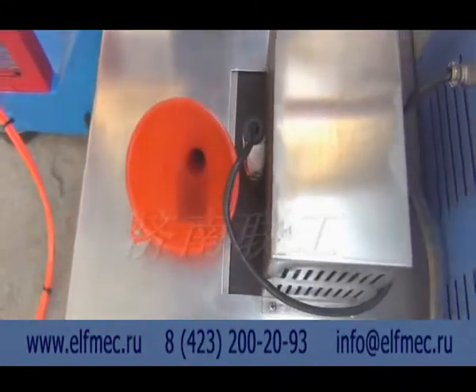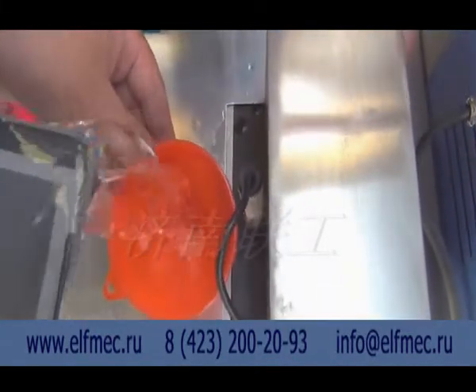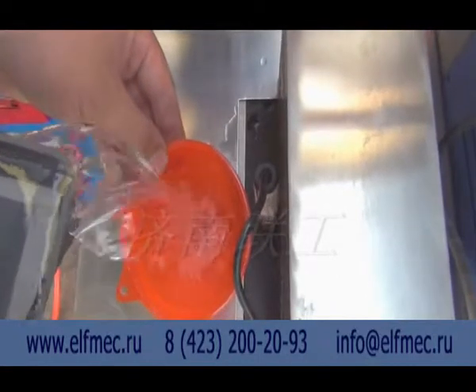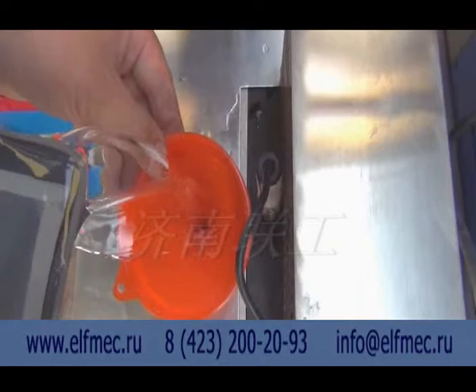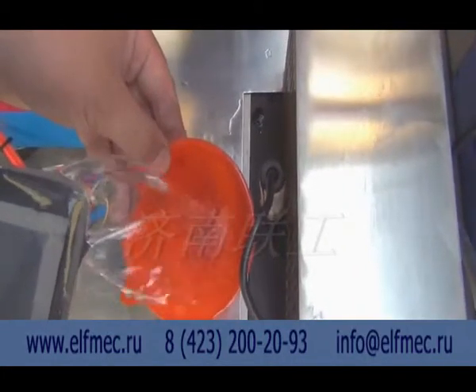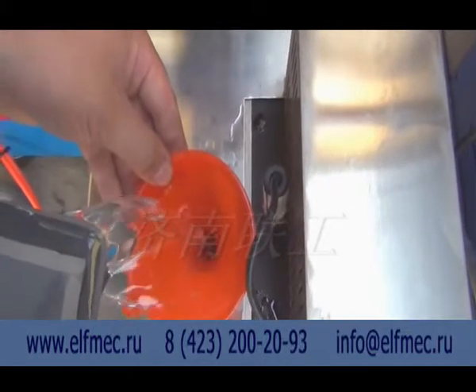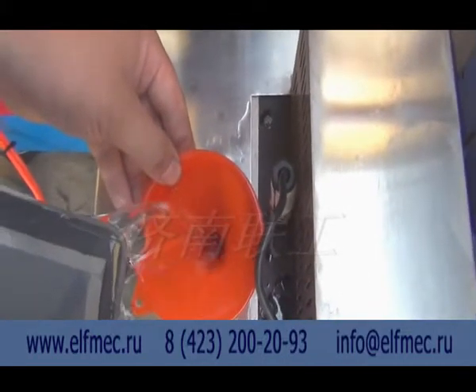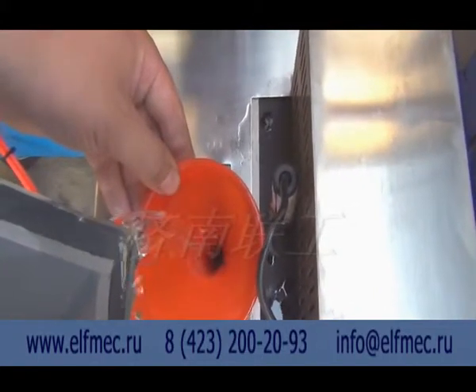Before doing the low temperature test, take out the sample box. Put the funnel on the guide slot of the box. Add absolute ethanol of 95% purity, about 8 liters. Put the sample into the box. We need to notice that the sample gaps should be in the same direction. The gap direction is in line with the pendulum impact direction.